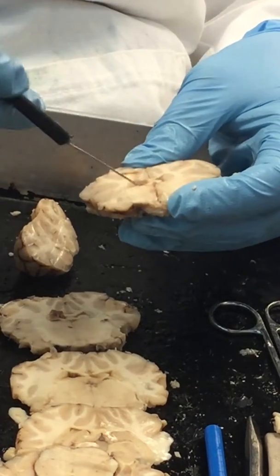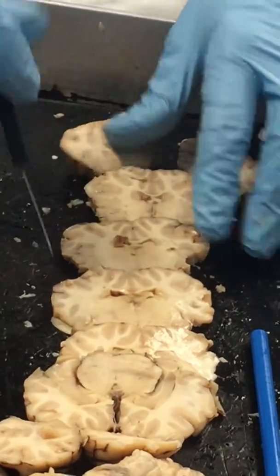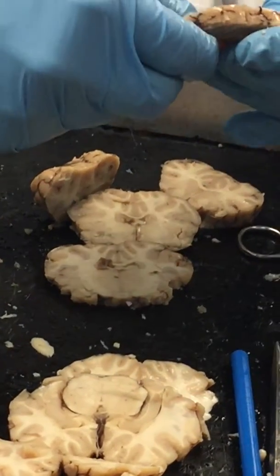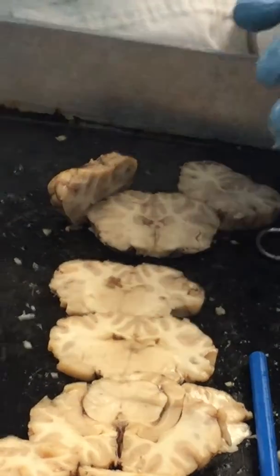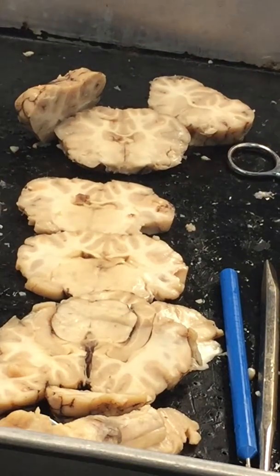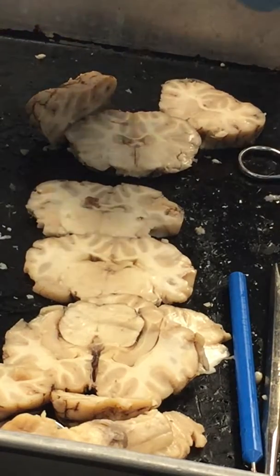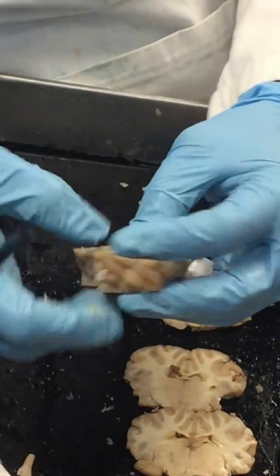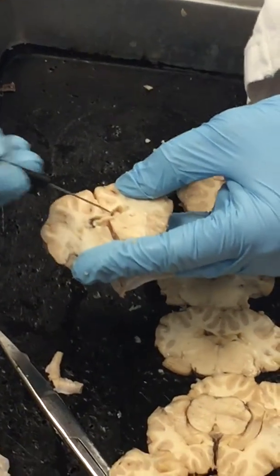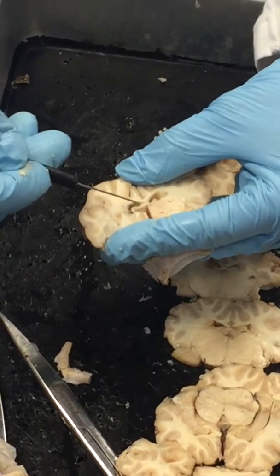Okay, so these are our lateral ventricles. They're on the left and right hemispheres. That corpus callosum runs between them. Now, what we remember, there is that real thin line. Let me see if I can see it on this section. Let me see your section real quick, being that it's a little thicker. Maybe not. Nope, too thick. Well, actually, this is a little thicker than it should be, but the septum pellucidum is that band that kind of goes between the two lateral ventricles. So we can kind of see this band here between the two of them.